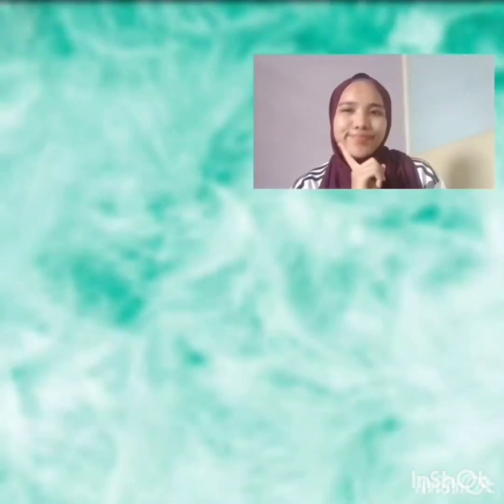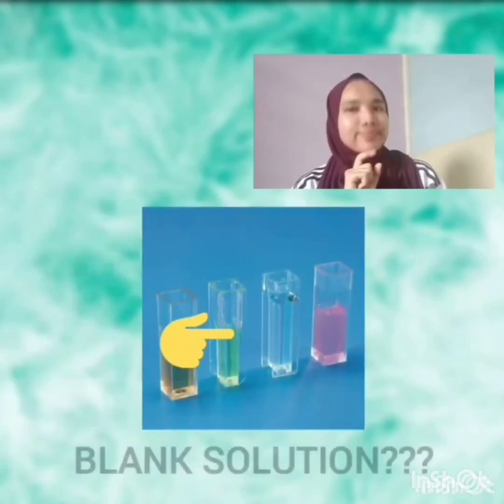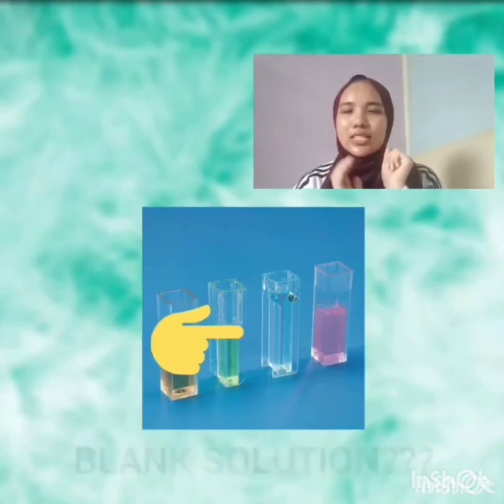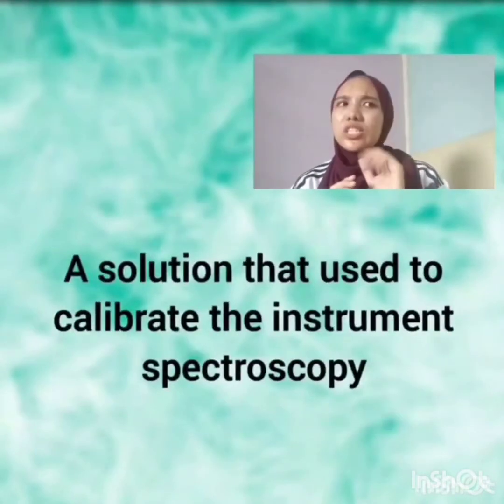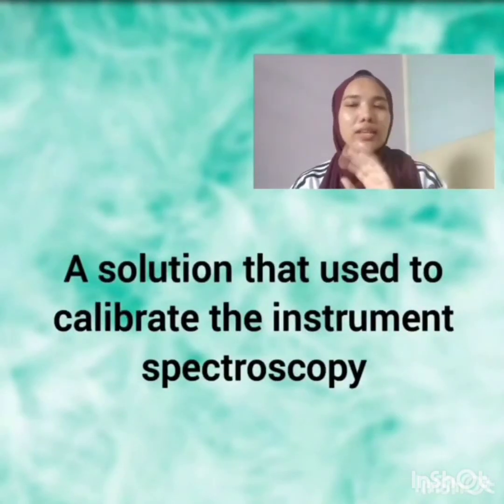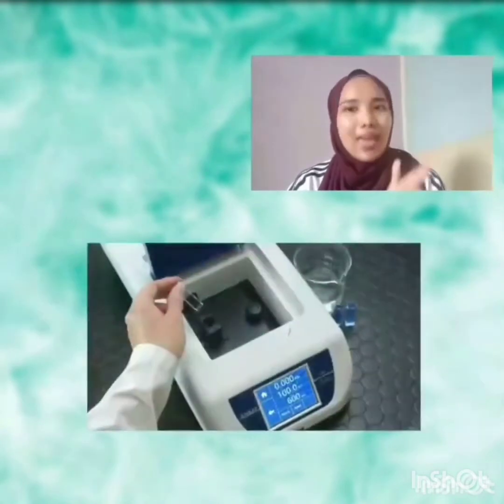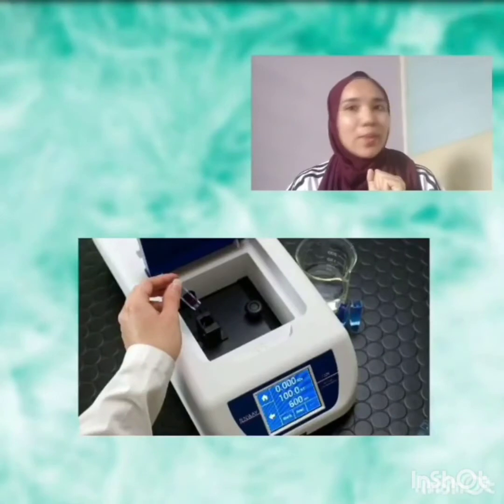Wait, did I miss something? I know. You forgot about the blank solution, right? So what is a blank solution? A blank solution is actually a solution which contains little to no analyte at all. So it is used to calibrate the instrument. Then you can continue to investigate the prepared solution.